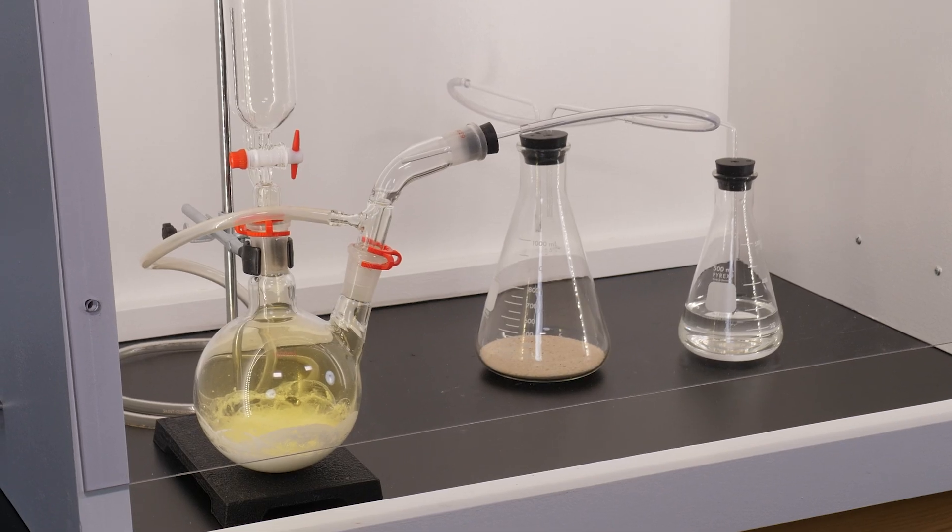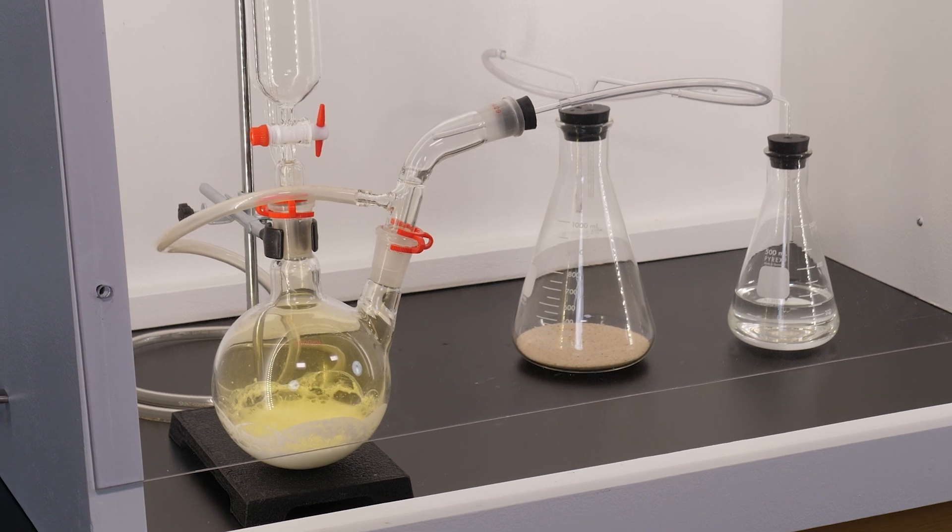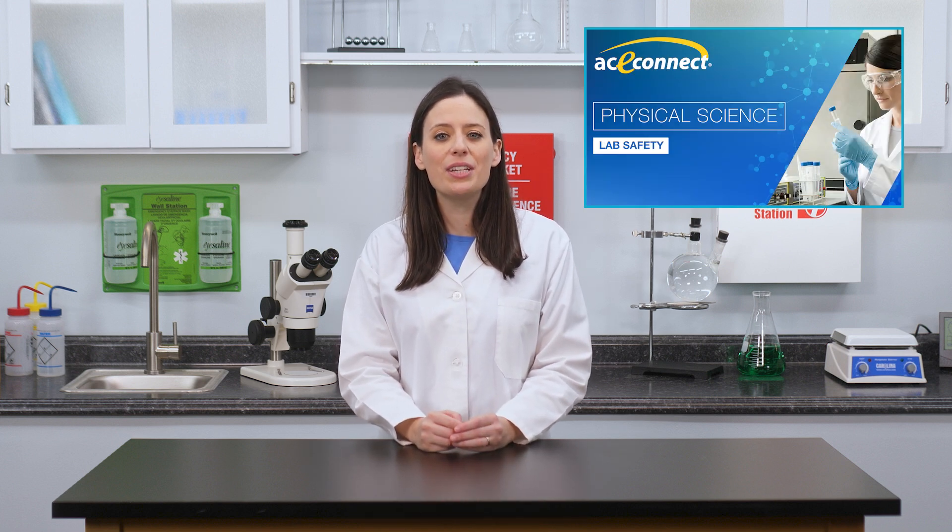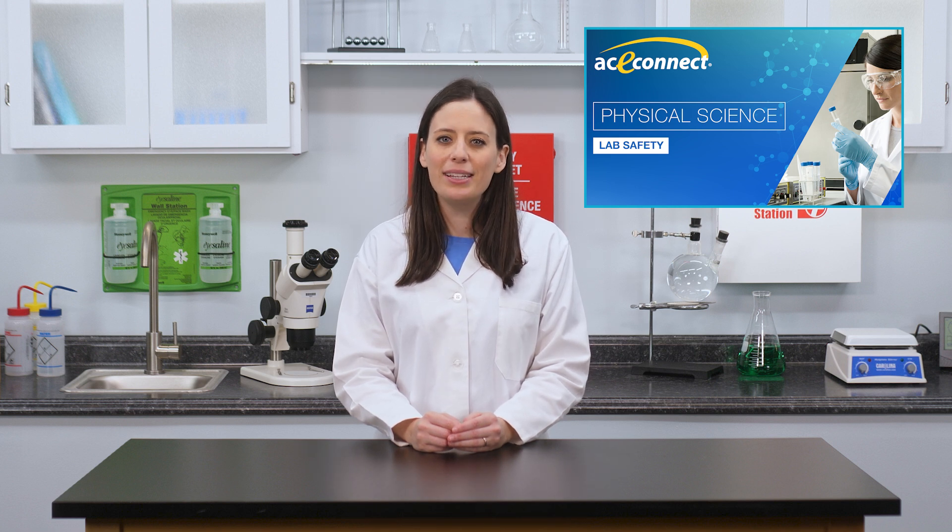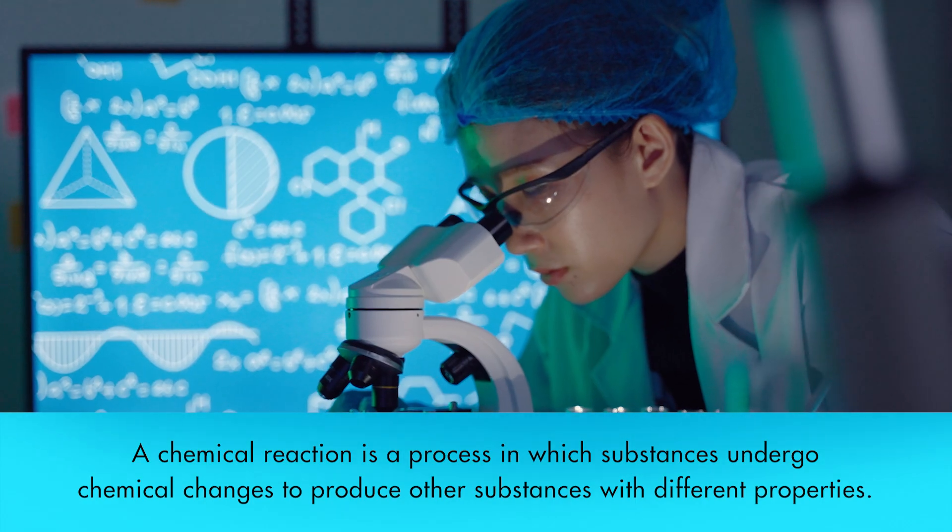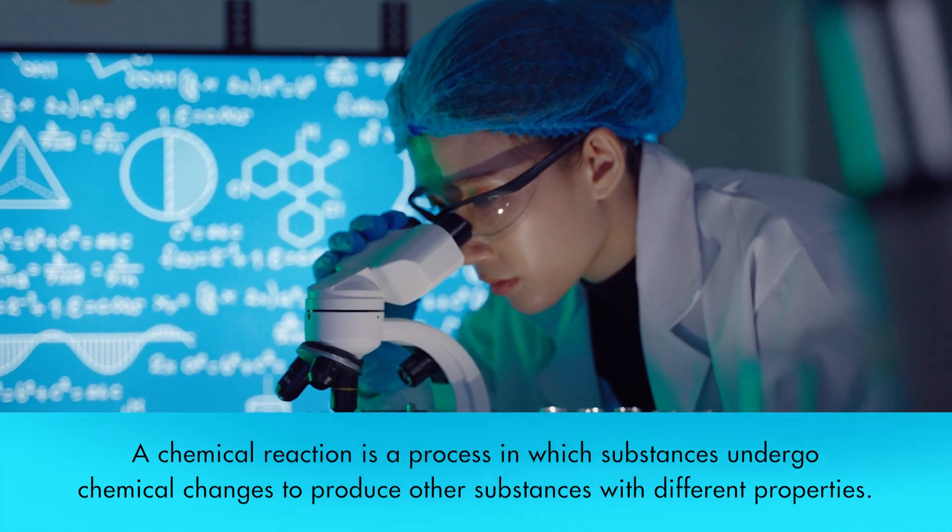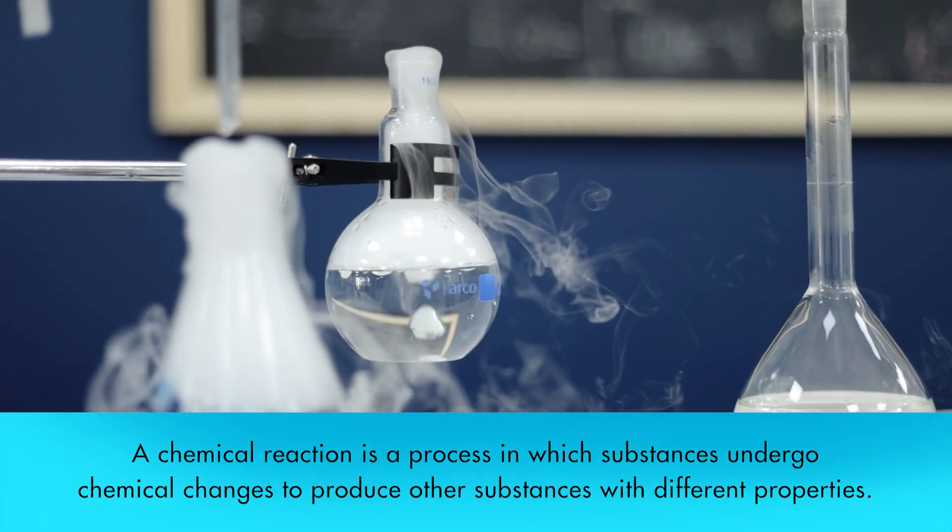In this lab, we will demonstrate some basic chemical reactions, including the reaction that produces salt. As always, before beginning any experiment in the laboratory, be sure you are familiar with laboratory safety requirements. For a demonstration of basic lab safety rules, you can watch our video entitled Lab Safety.